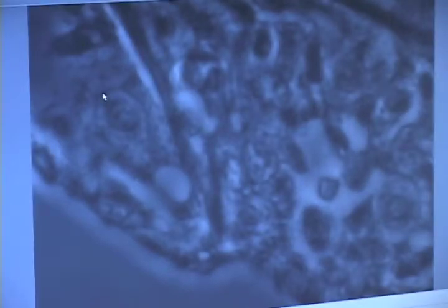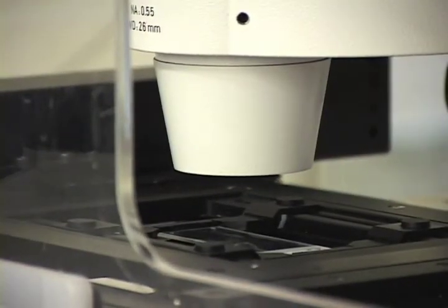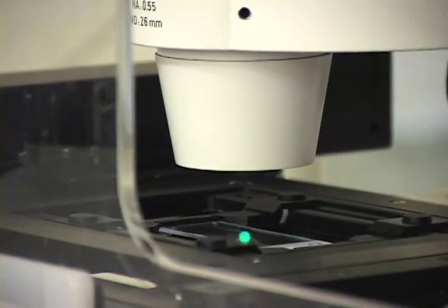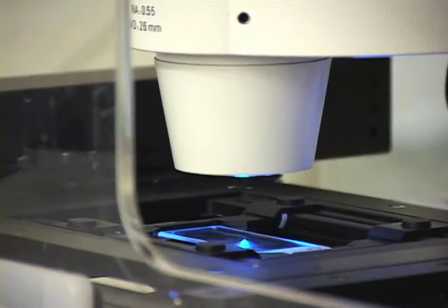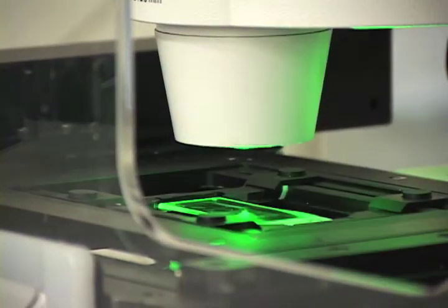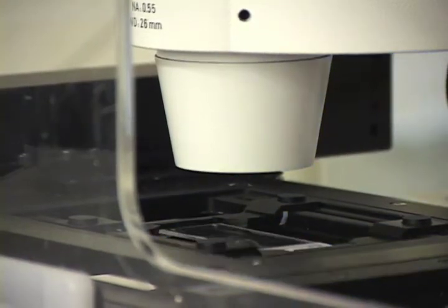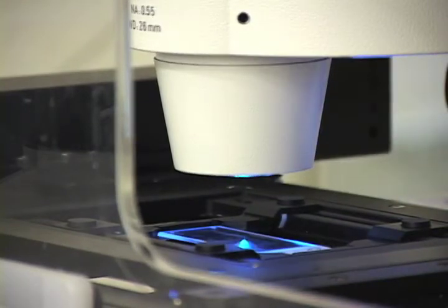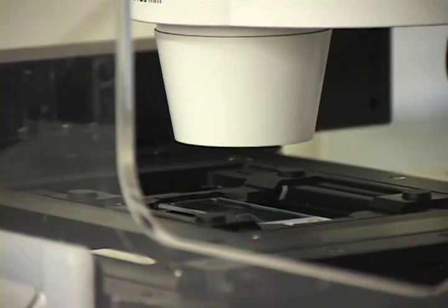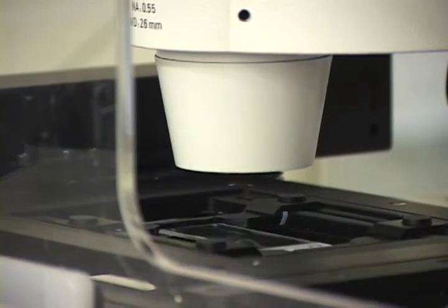And the theory, you have learned about that in lecture already. Since we haven't modified the commercial microscope, we can easily switch between SLIM and a selection of 6 different fluorescence filters. That way we can not only quantify the optical path length differences, which report on cell mass and growth, but we can also say with specificity what the structures we're looking at are, and use fluorescence to report on specific cellular behavior, such as what part of the cell cycle the cell is in, or whether it's expressing a specific gene.